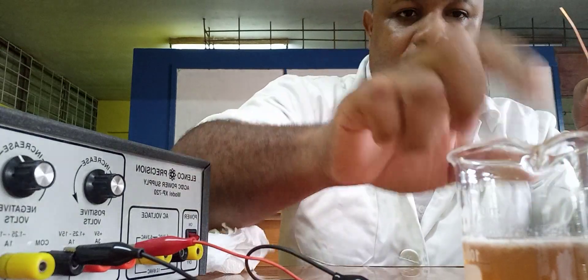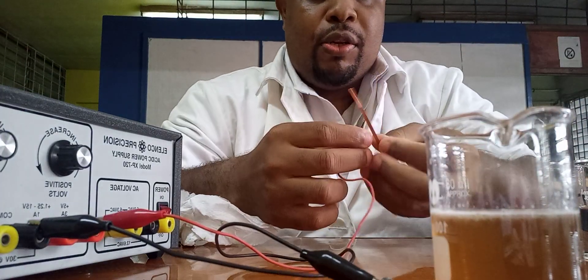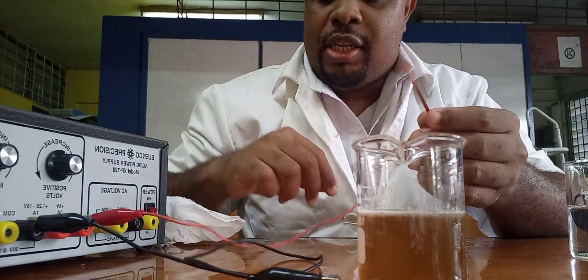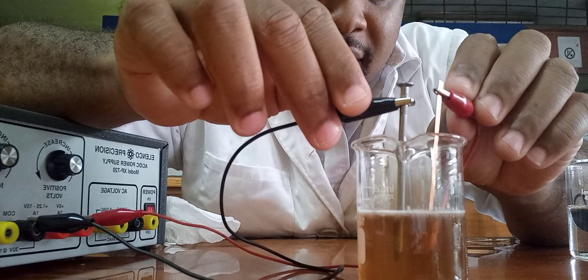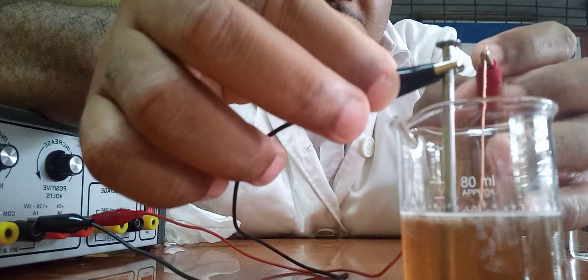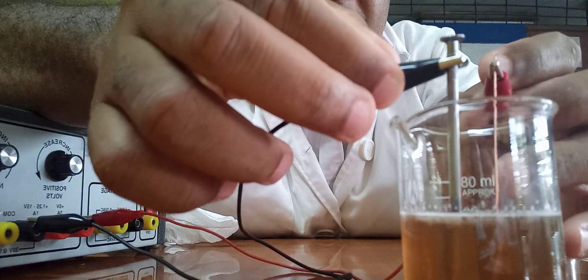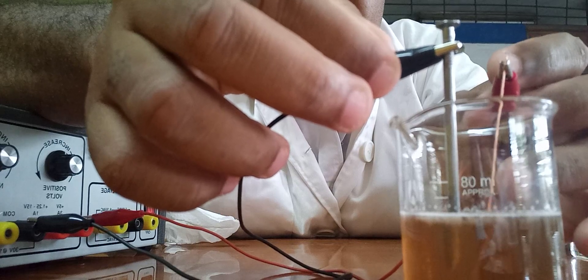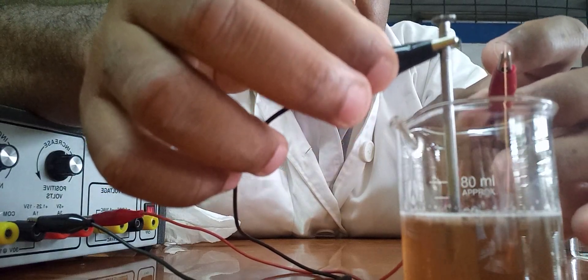Next up we have sucrose — this is table sugar. We are going to see if sucrose is an electrolyte. All we need to see is the formation of bubbles. Place it inside — if you look at the nail, there is nothing occurring. There are no bubbles being produced. No reaction is taking place, which means the solution is not being decomposed. So sucrose, which is table sugar, by our observation here, it is not an electrolyte.